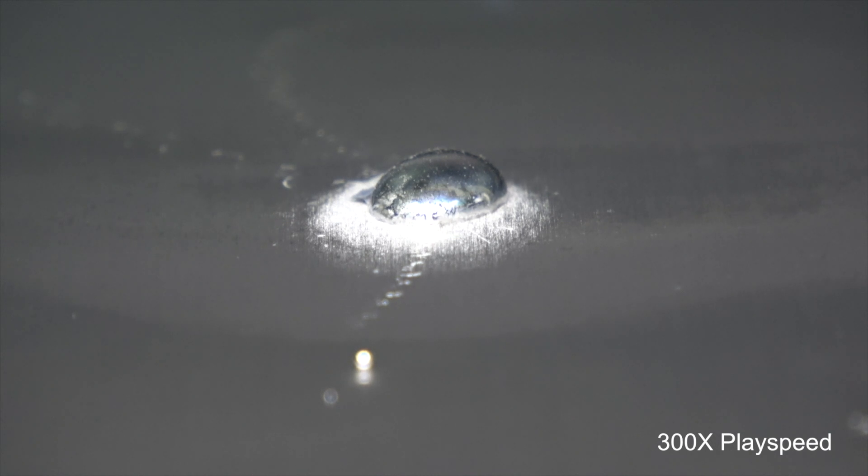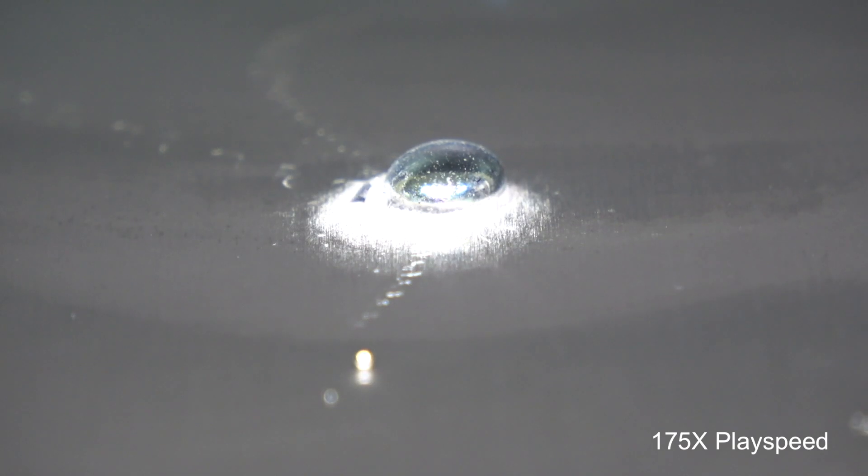It might not be obvious, but if you watch carefully, you can see the size of the mercury droplets is getting less and less as amalgamation is taking place.